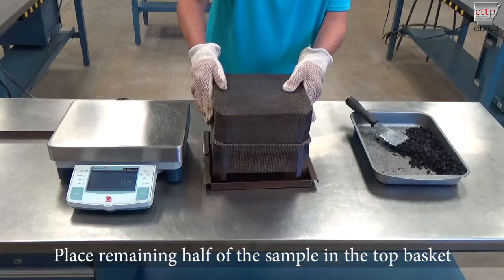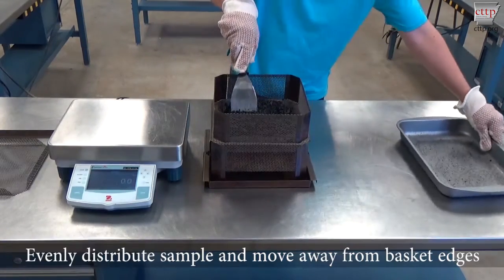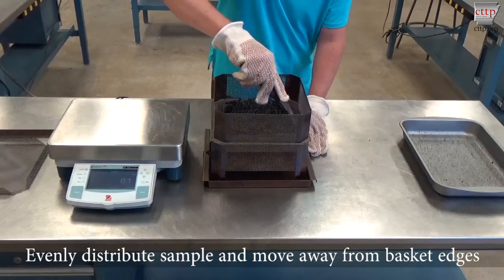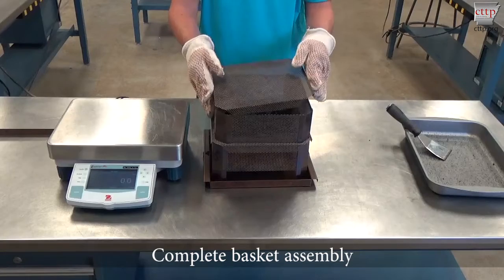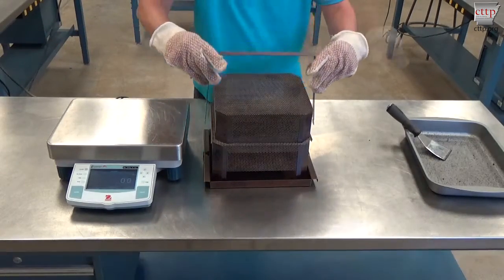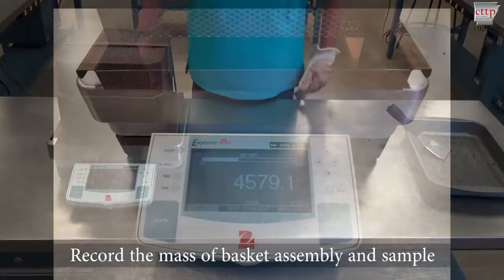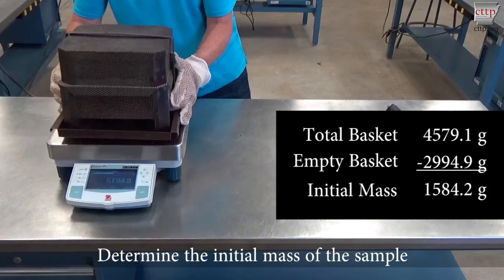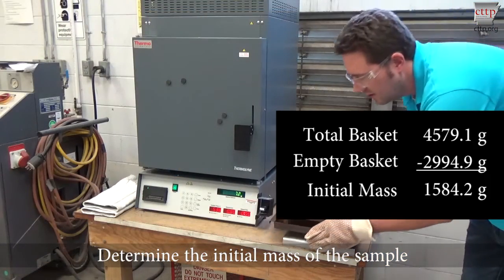Replace the top basket and remove the lid. Place the remaining half of the sample in the top basket. Evenly distribute the sample and move the mix away from the basket edges. Complete the basket assembly by securing the lid and assembly guard. Zero the scale and place the basket assembly on the scale platform. Record the total mass of the basket assembly and sample. Determine the initial mass of the sample by subtracting the mass of the empty basket assembly from the total mass of basket assembly and sample.